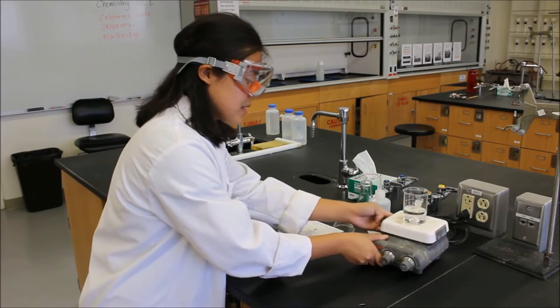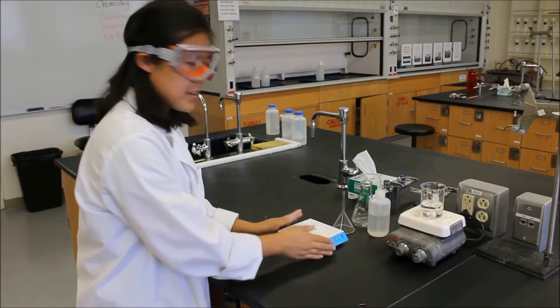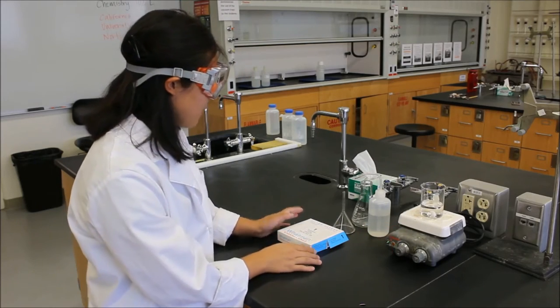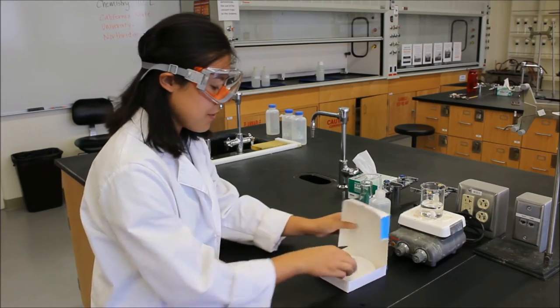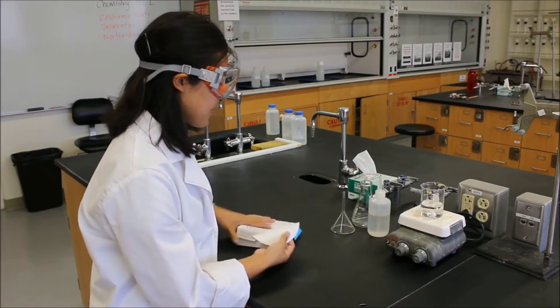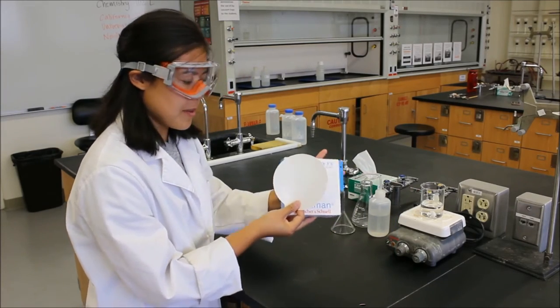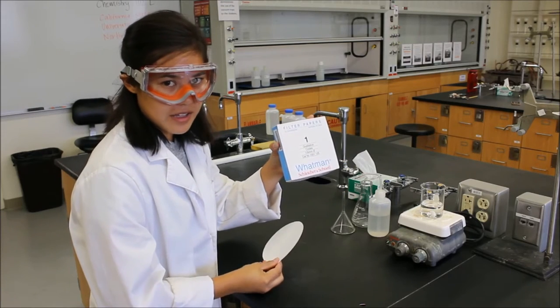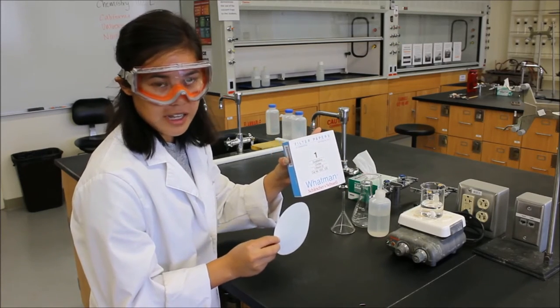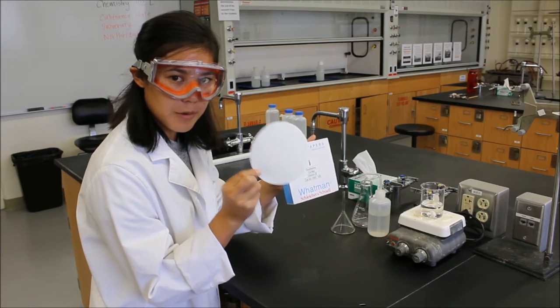So that's how to use a stir bar with the hot plate. What I'll show you now is how to fold the filter paper. You'll want to get one large filter paper here. In the lecture, I'll show you where they are in the classroom. But you want one of these.